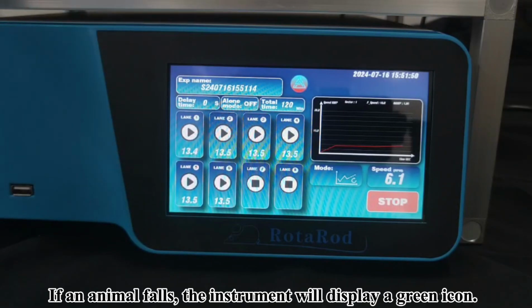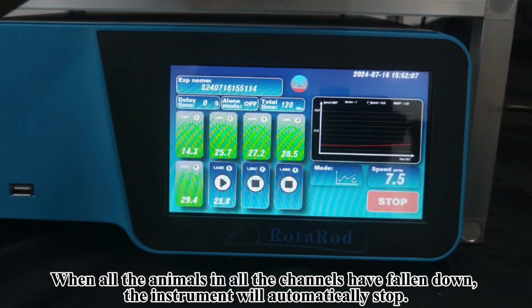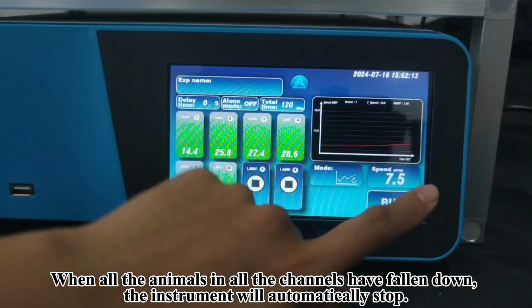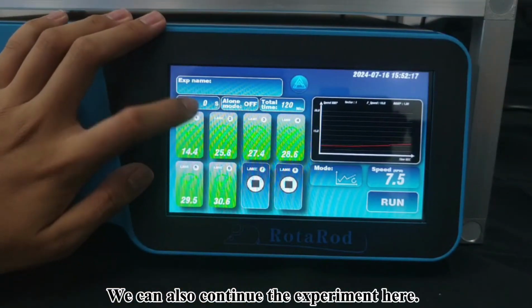If an animal falls, the instrument will display a green icon. When all the animals in all the channels have fallen down, the instrument will automatically stop. We can also continue the experiment here.